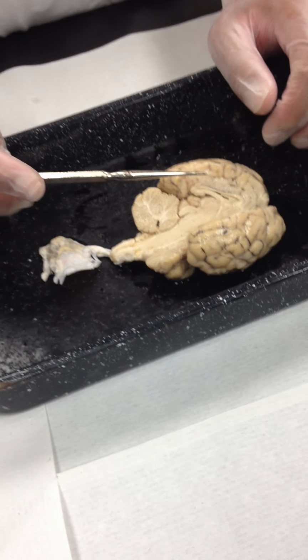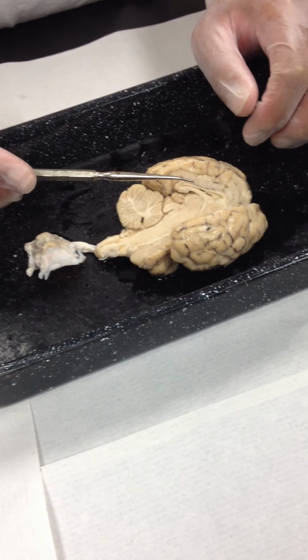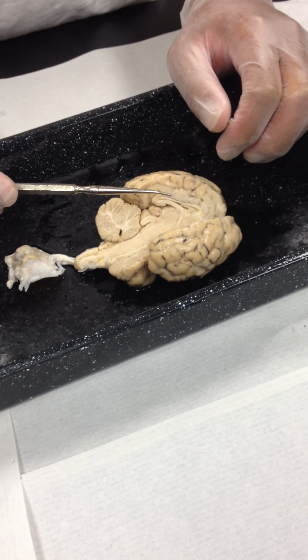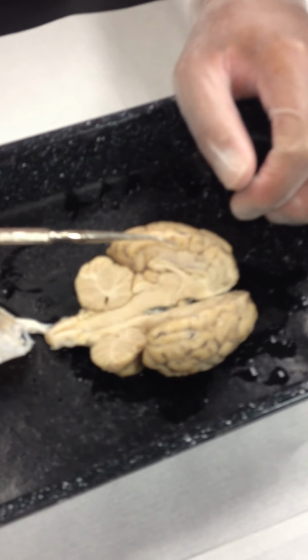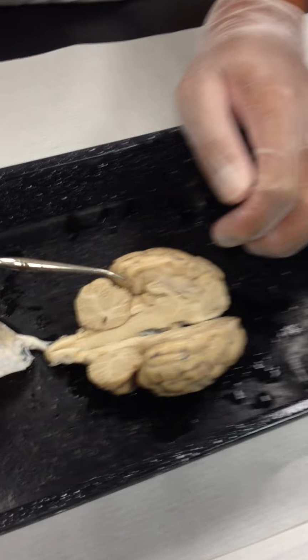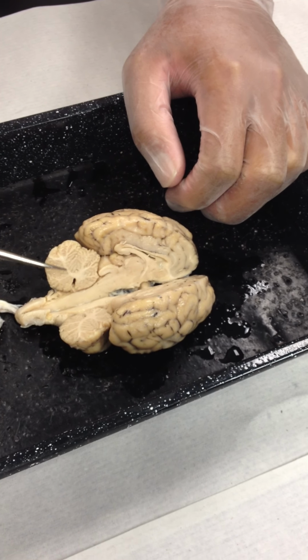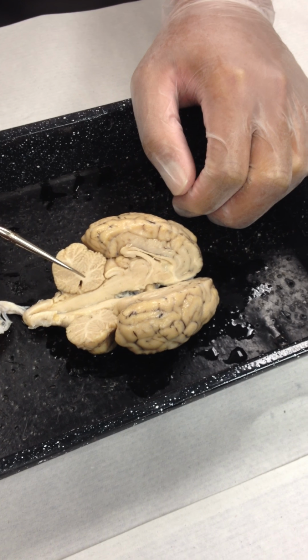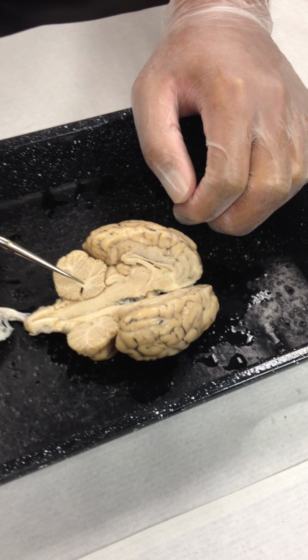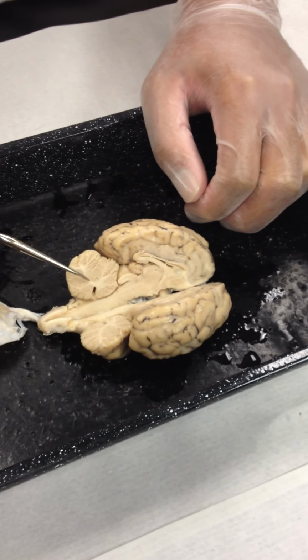I've got a brain here that we have already opened, and we'll take a look at the insides of this. So we're looking at an inferior view right now. I'll turn it back over to the superior view. It'll fall in half like this when you've made your cut. Okay, looking at the halves here, here's the cerebellum in the sagittal section. We can see that there's two kinds of material in the cerebellum. There's this darker outer gray matter, and then there's a branched pattern of white matter. The branching pattern of the white matter is called the arbor vitae. It means tree of life. It's a branching tree-like pattern.